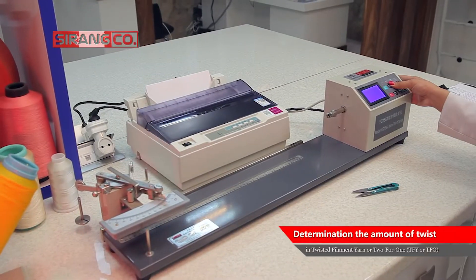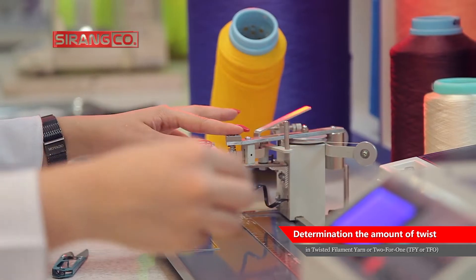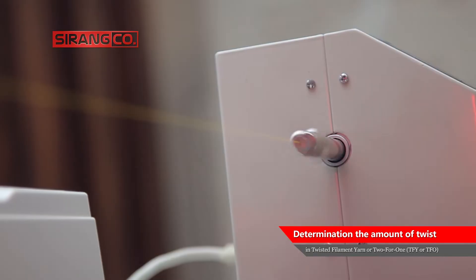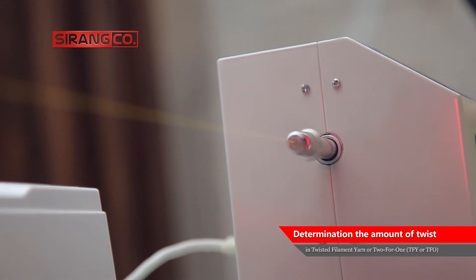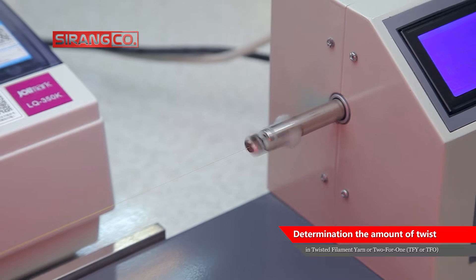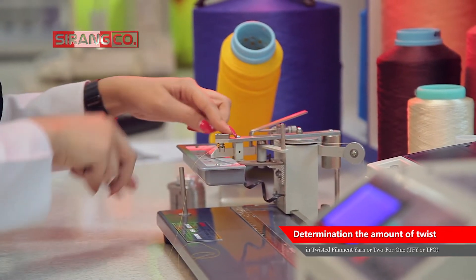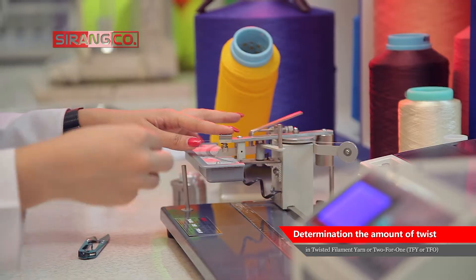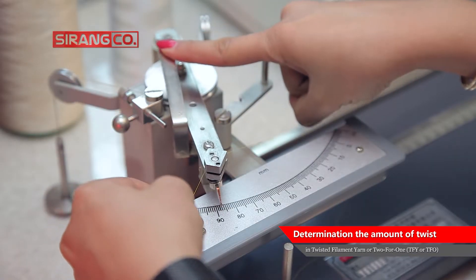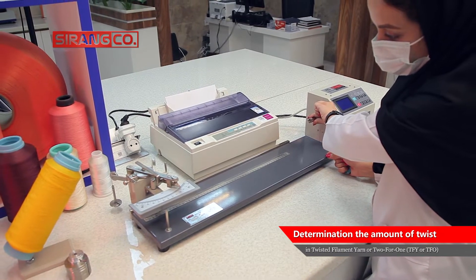The twist tester consists of a pair of clamps, one of which can rotate with adjustable speed in both directions — clockwise or counterclockwise — and is directly connected to the counter. The adjustability of this clamp allows the user to adjust the length of the test sample as desired. This device is also equipped with a system for applying pretension to the test sample.